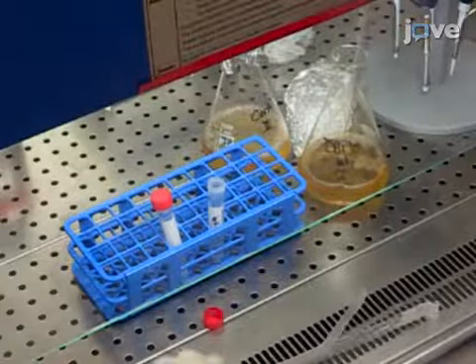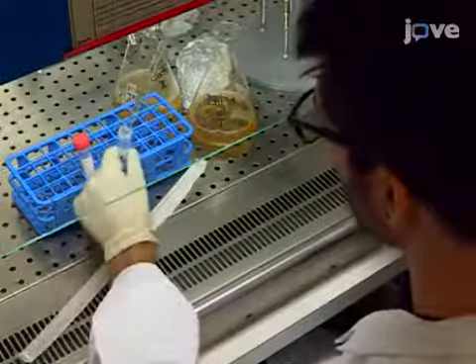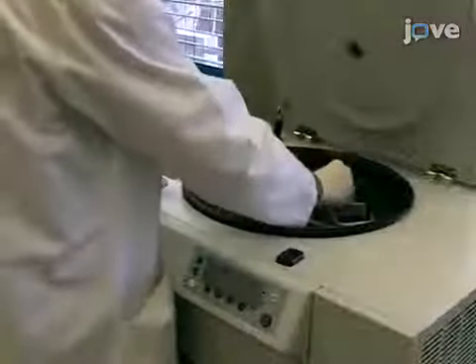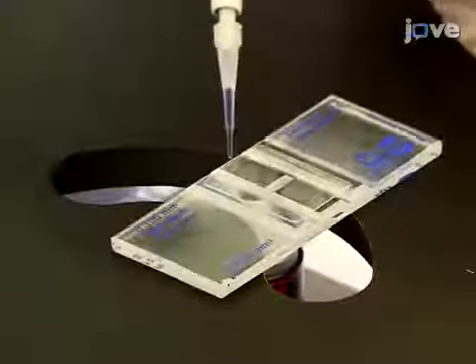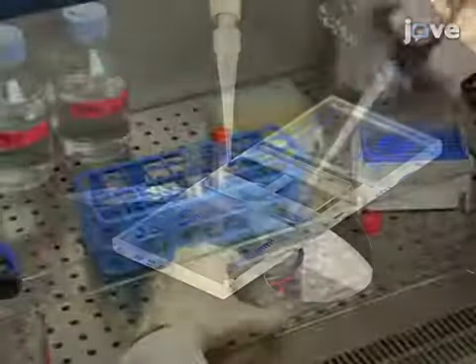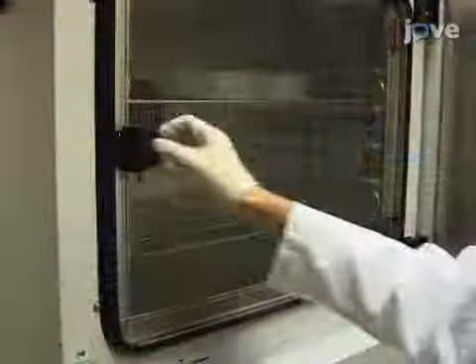To examine cell aggregation, harvest 10 to 50 milliliters of log phase growing DH1.10 cells or Coronin-deficient cells generated in the DH1.10 background. Centrifuge them for 3 minutes at 400 × g. Then wash the cells twice in BSS. Afterward, count the cells using a hemocytometer. Subsequently, plate the cells in a 24-well plate. Allow them to adhere for 1 hour at 22 degrees Celsius in BSS.